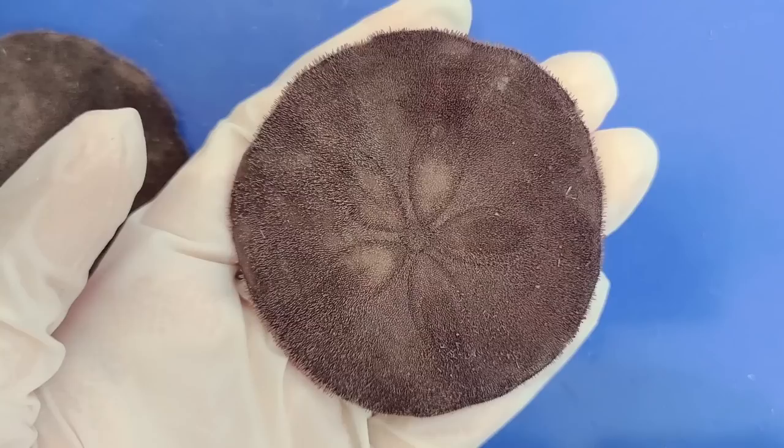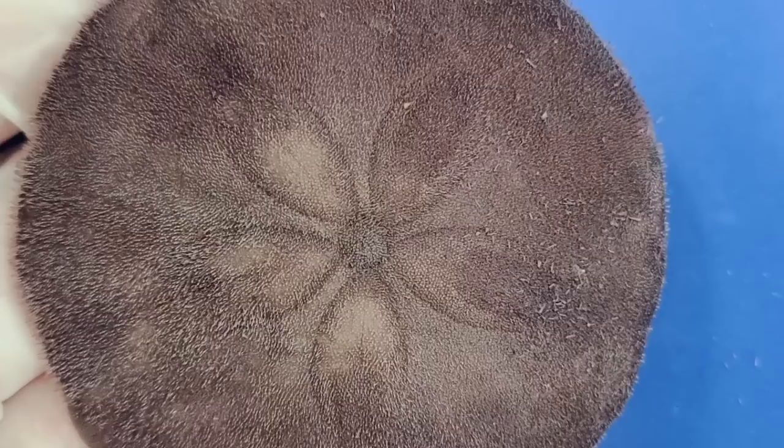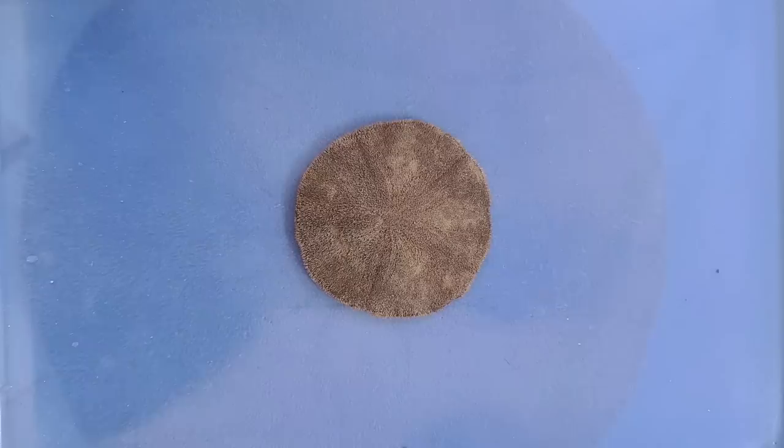The madreporite is the opening to the water vascular system, pumping water in and out to move the tube feet. There are also four tiny pores around the madreporite which are called the gonopores. The gonopores are where the sperm or eggs will be released for reproduction.